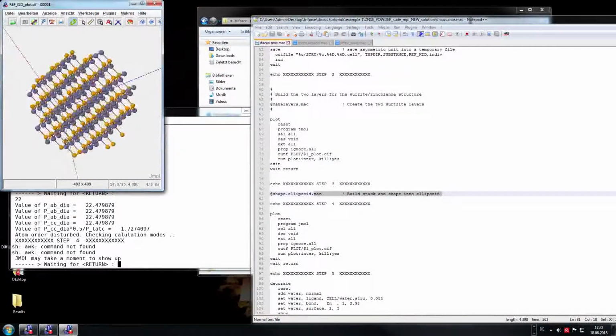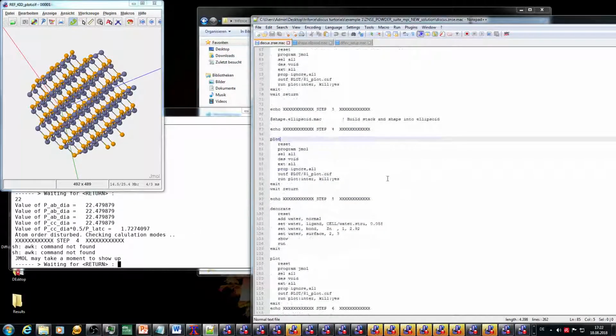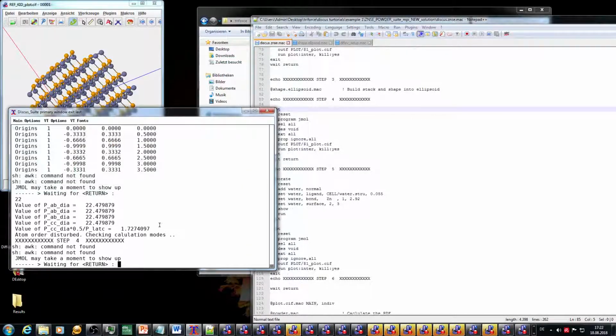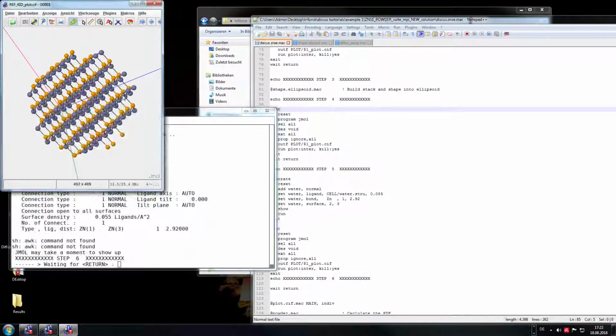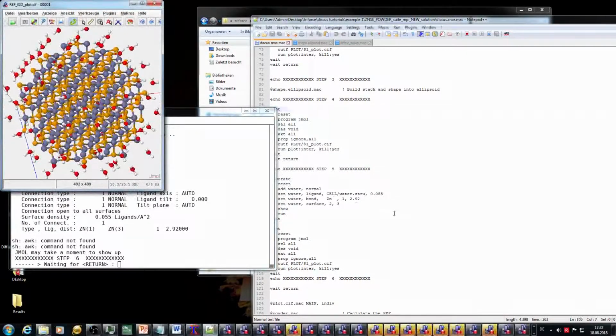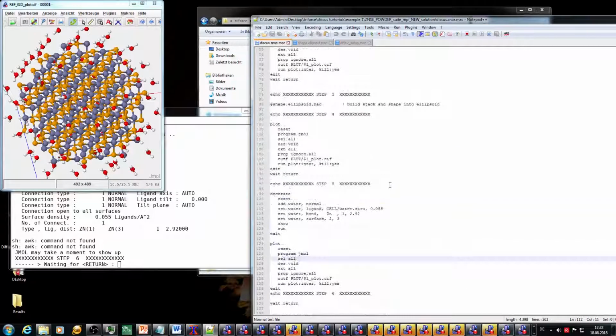Okay, and that's how we generally locate errors. We put in the echoes. You can optionally add these plots in there, but it's a nice way to find errors, and then the macro finishes to the end, so it creates the final particle sphere with some ligand decoration, and then it goes into refinement of the powder pattern down here. Okay, that was the first part, how to find an error.